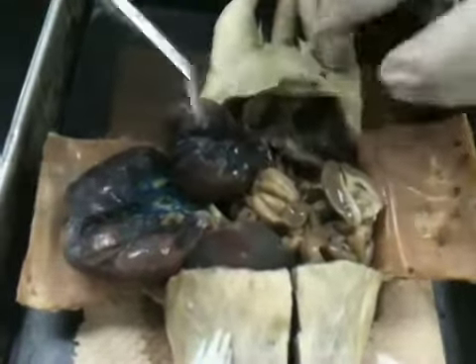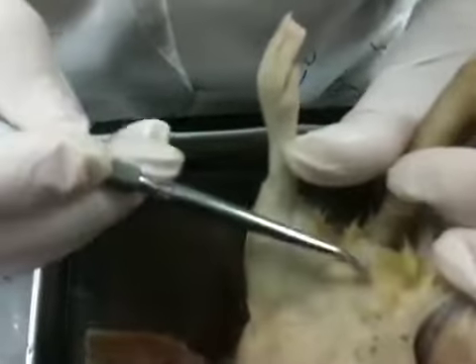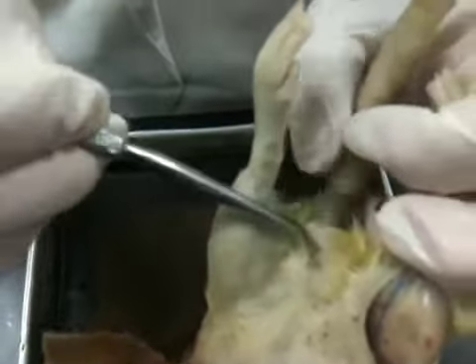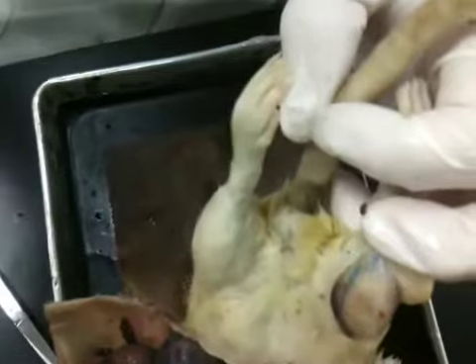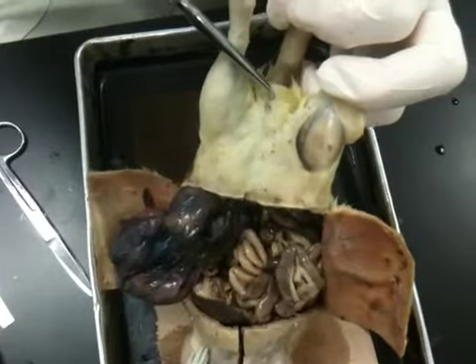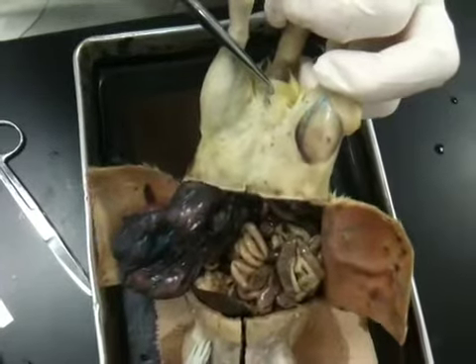Vagina then down in there, but we can see the vagina. So urethra right here, vagina is right there, and then of course you can see the anus right by the tail. So these babies have to come out that vagina. Yes, I know.